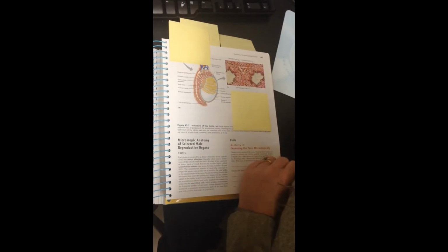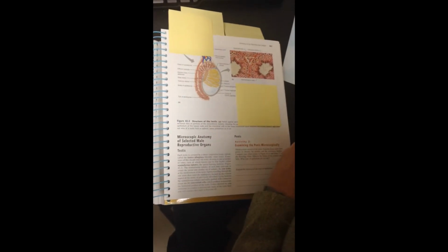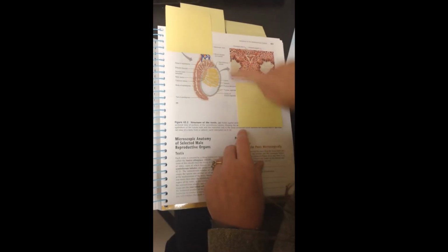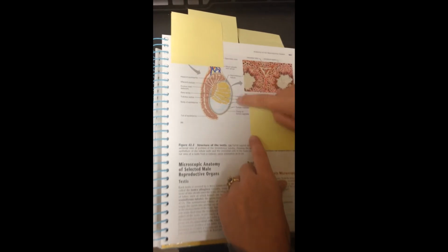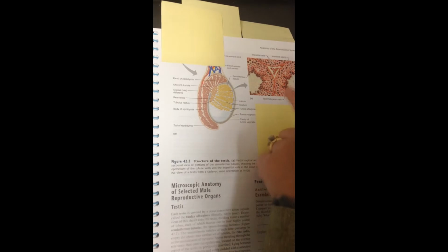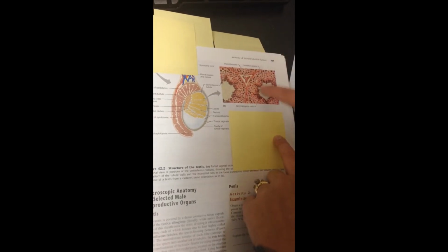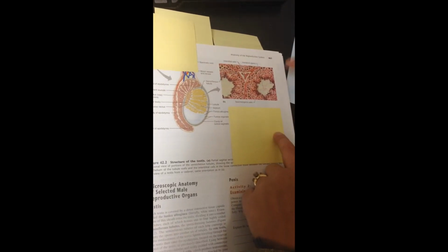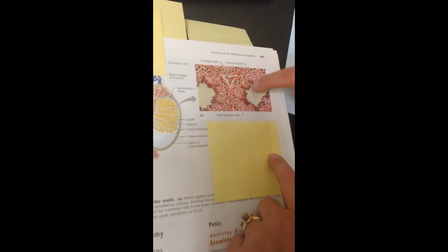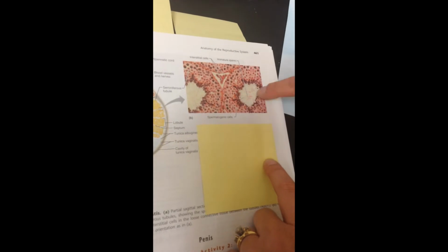Guys, your next slide is a slide of seminiferous tubules. This is in the testes where sperm are made. So this is a testicle, and as you can see, a cross section actually is the testes are made up of all these tiny little tubes. This represents a cross section of the inside of one of those tubes, and you'll notice a lot of flagella right here. The heads of the sperm are in the wall here, and their flagella are here, and when they become mature, they'll release and swim down that tubule.